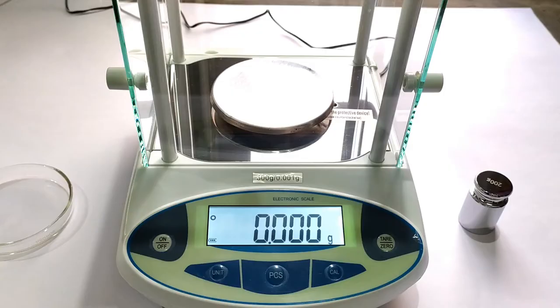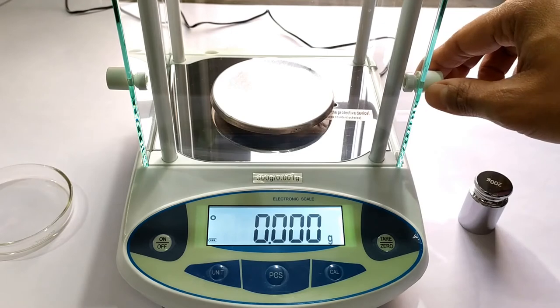Okay so it's been about half an hour and as a brand new product straight out of the box, I thought it would be a good idea to calibrate the device before doing anything else with it. So going by what the calibration instruction says, we first press the CAL button on an empty weighing pan.